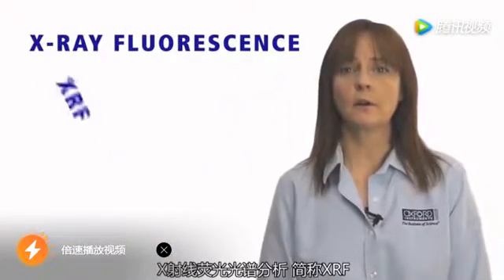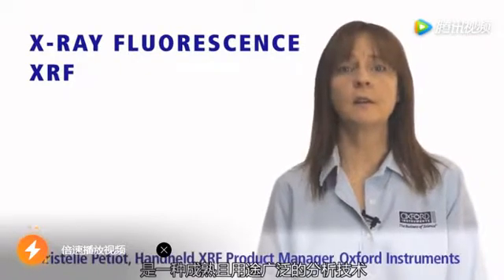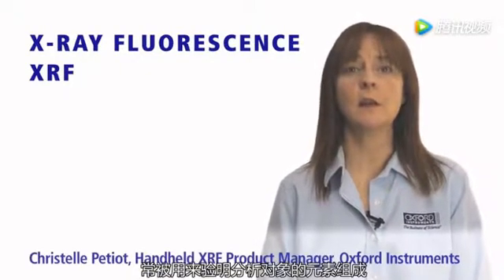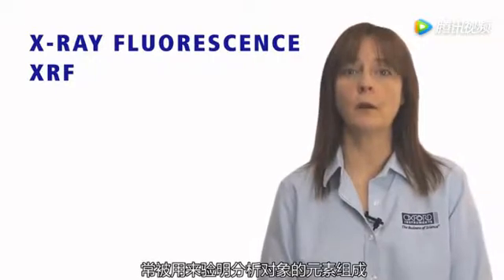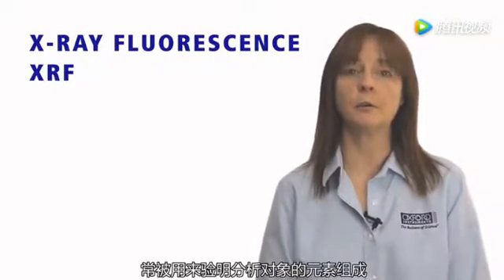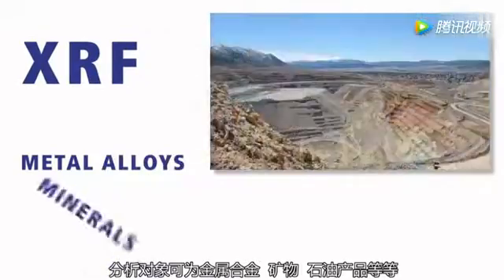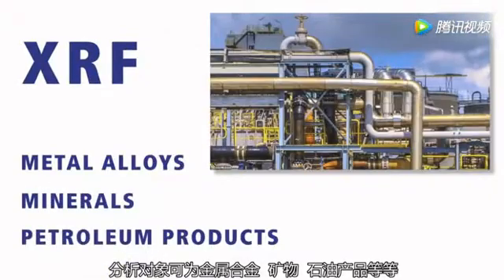X-ray fluorescence, or XRF, is an analytical technique that has been used for many years to determine the elemental composition of a wide variety of materials. Examples include metal alloys, minerals, and petroleum products.